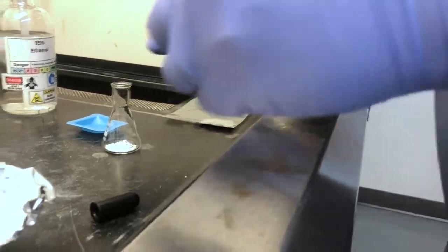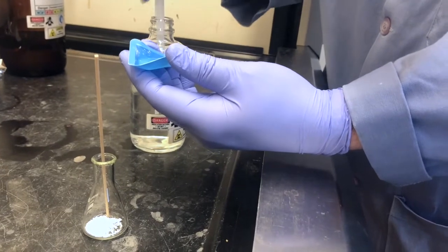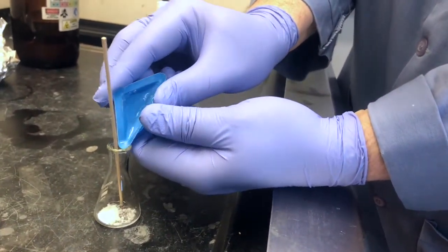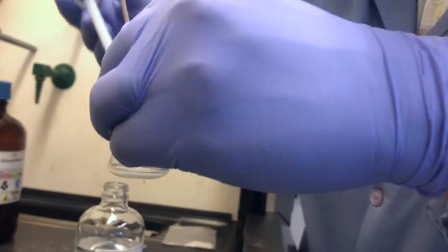That's really good. At this point, we add enough solvent to just barely cover the crystals. You can see I'm using 95% ethanol solvent to rinse out a little bit of the weighing boat after reserving a little bit to the side. And unfortunately, we were supposed to use the 1-to-1 ethanol water mixture, but I was using pure ethanol. Is that covered? And you'll see the result of this error, which I didn't catch until watching this video back several months later.